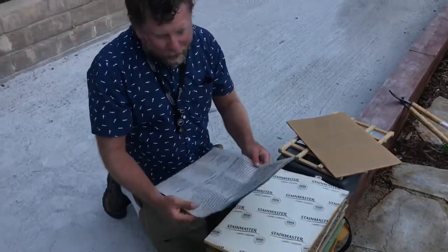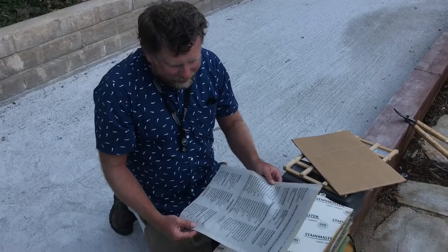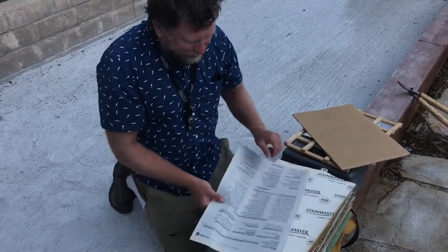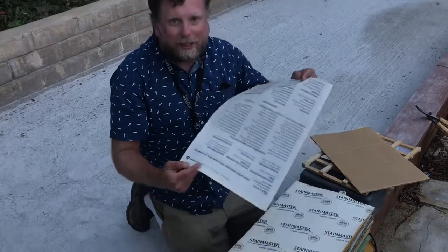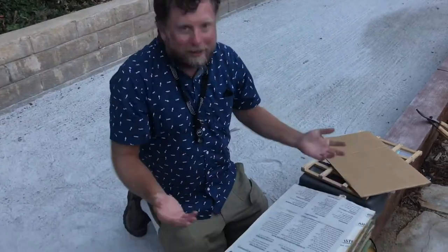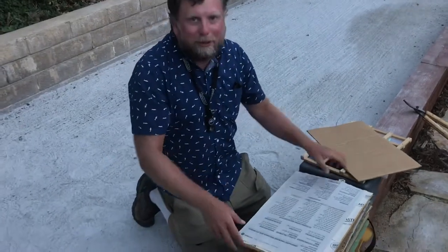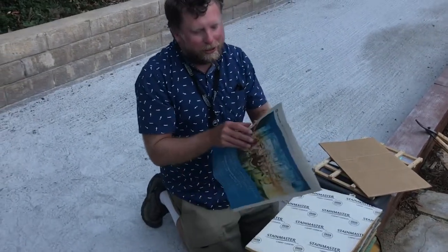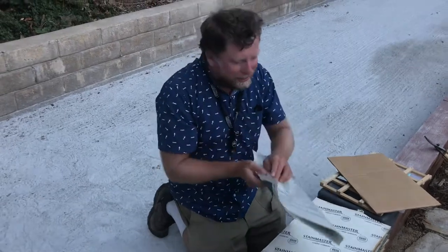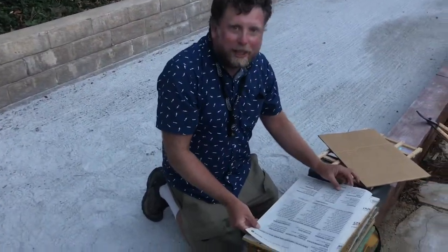Basically we have a piece of newspaper — which the kids don't know what that is. The UCLA Daily Bruin is the perfect size. A normal newspaper used to be too long, but the Bruin — I forget what you call this size — fits perfectly in the press. And out of curiosity, what date is on that Daily Bruin, John? Monday, June 12th, 2017.